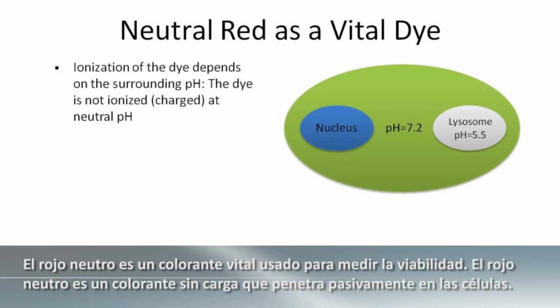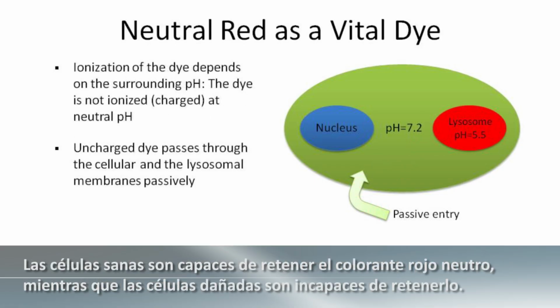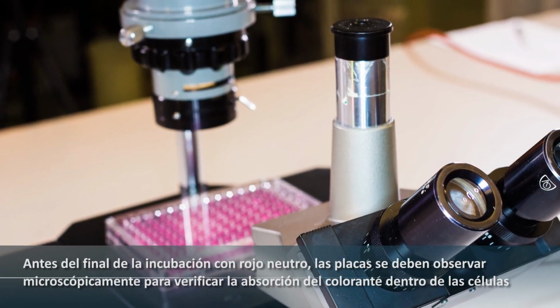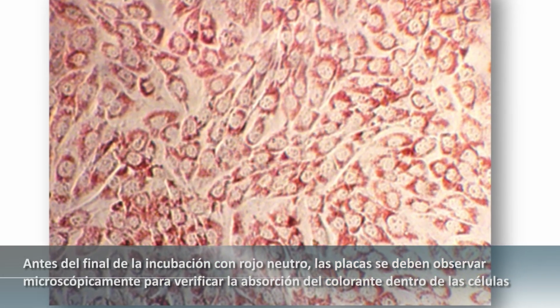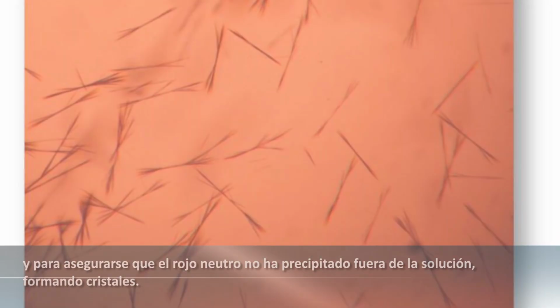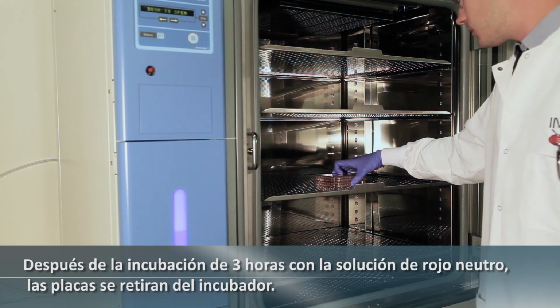The neutral red is a vital dye used to measure viability. Neutral red is an uncharged dye that passively enters into cells. Once in the acidic lysosomes, the neutral red becomes charged and trapped within the lysosomes. Healthy cells are able to retain the neutral red dye, while cells which have become damaged are unable to retain the neutral red. Prior to the end of the incubation with neutral red, the plate should be observed microscopically for neutral red uptake within the cells and to assure that the neutral red hasn't precipitated out of the solution, causing crystals. After the 3-hour incubation with the neutral red solution, the plates are removed from the incubator.